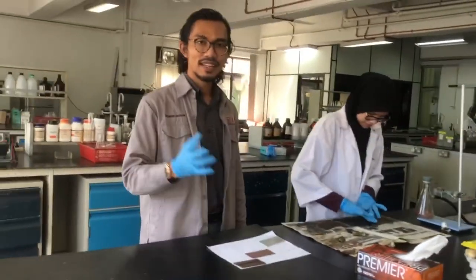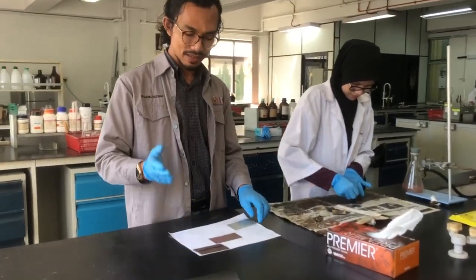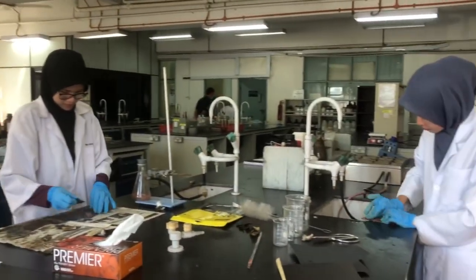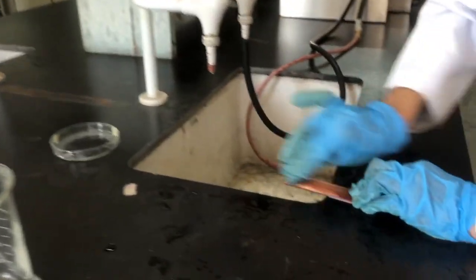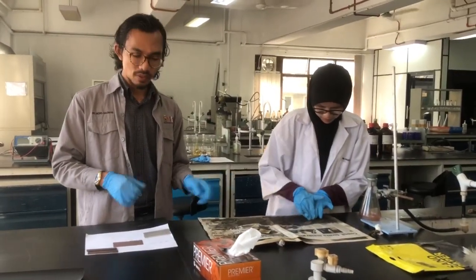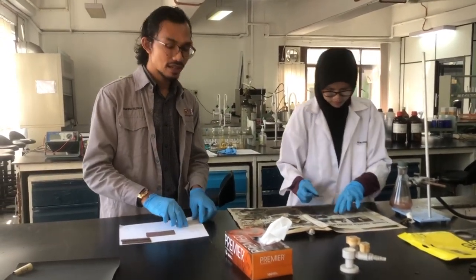Welcome back. As mentioned in the briefing, the first thing we need to do is polish the plates. You will be provided with different types of plates — copper, zinc, aluminum, and iron. Students are doing wet polishing using sandpaper. Wet polishing facilitates the abrasion process. When polishing, please make sure to go in one direction only — not multiple directions — to ensure a homogenized surface.